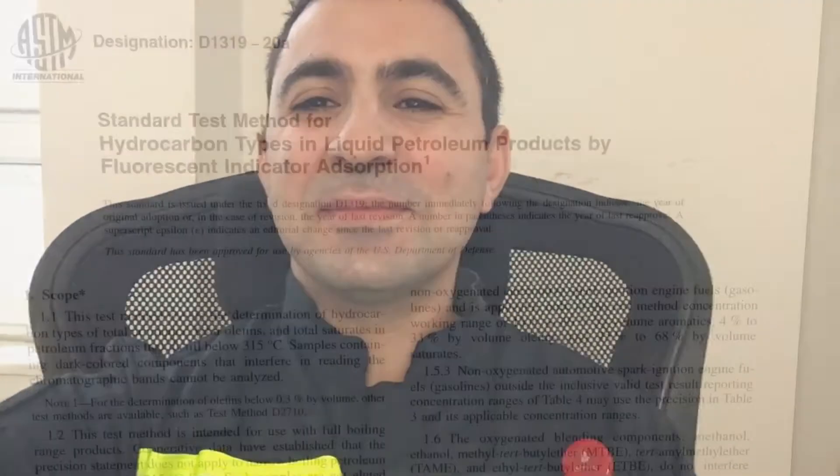It's really good to know these videos are helping some colleagues who work in the oil and gas field. As you noticed, I have started the video from my office because in this video I want to show the ASTM method remarks and specific sections. After that we will go down to the laboratory and see the system and a real-time analysis. Okay, let's get started.